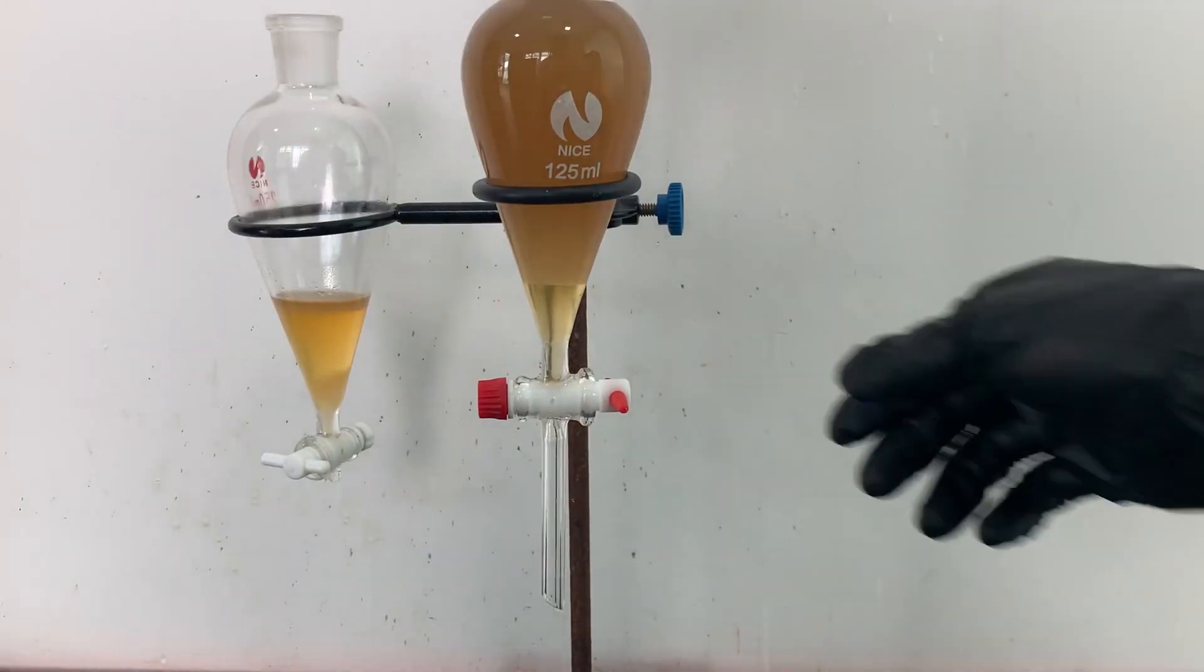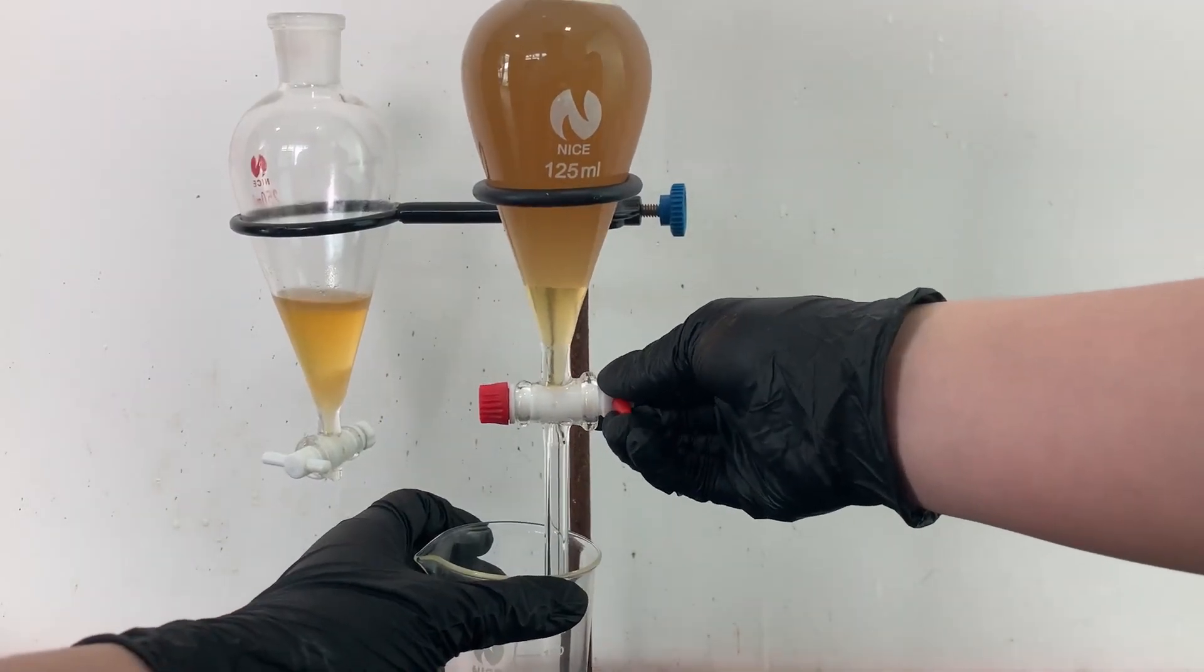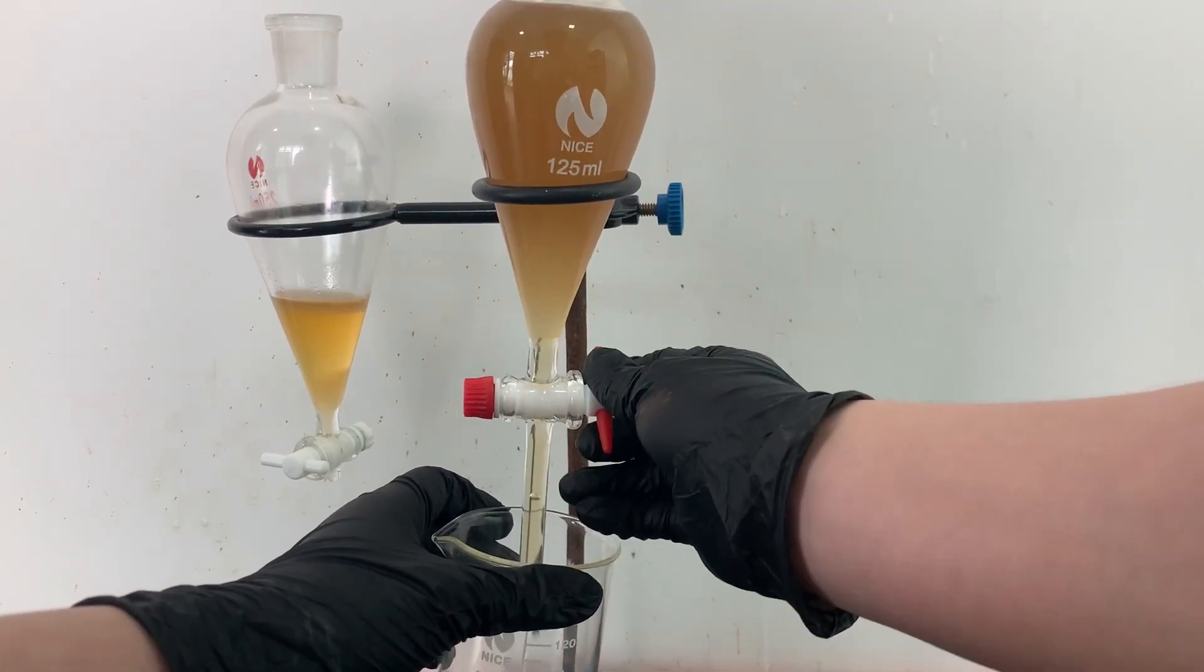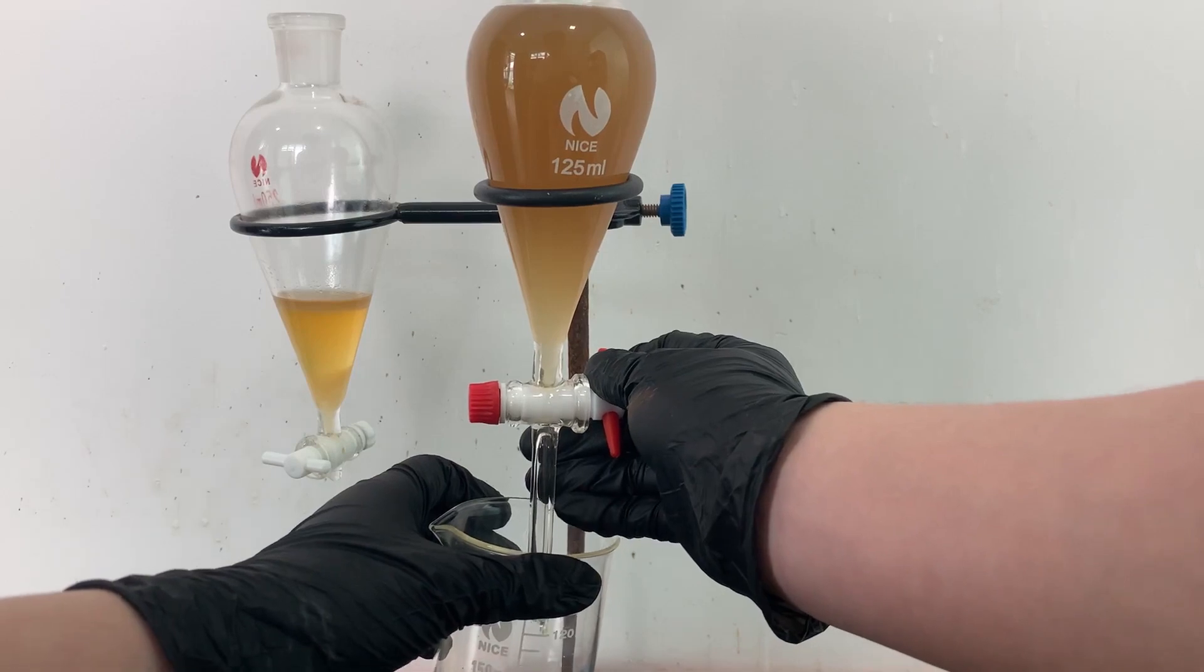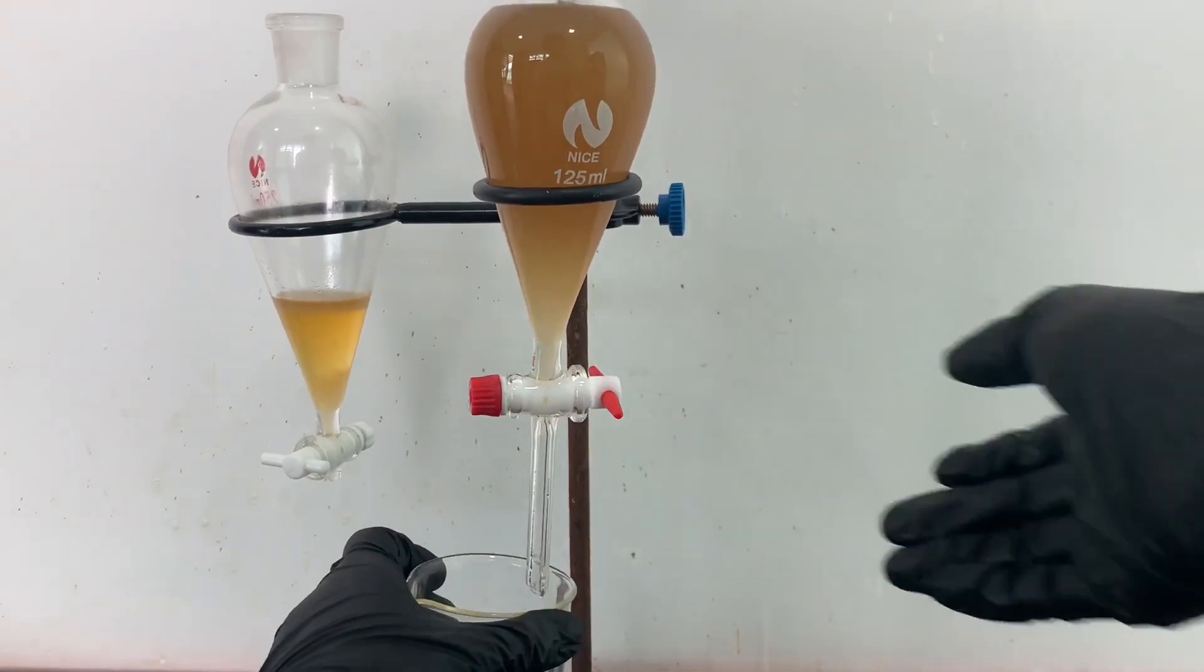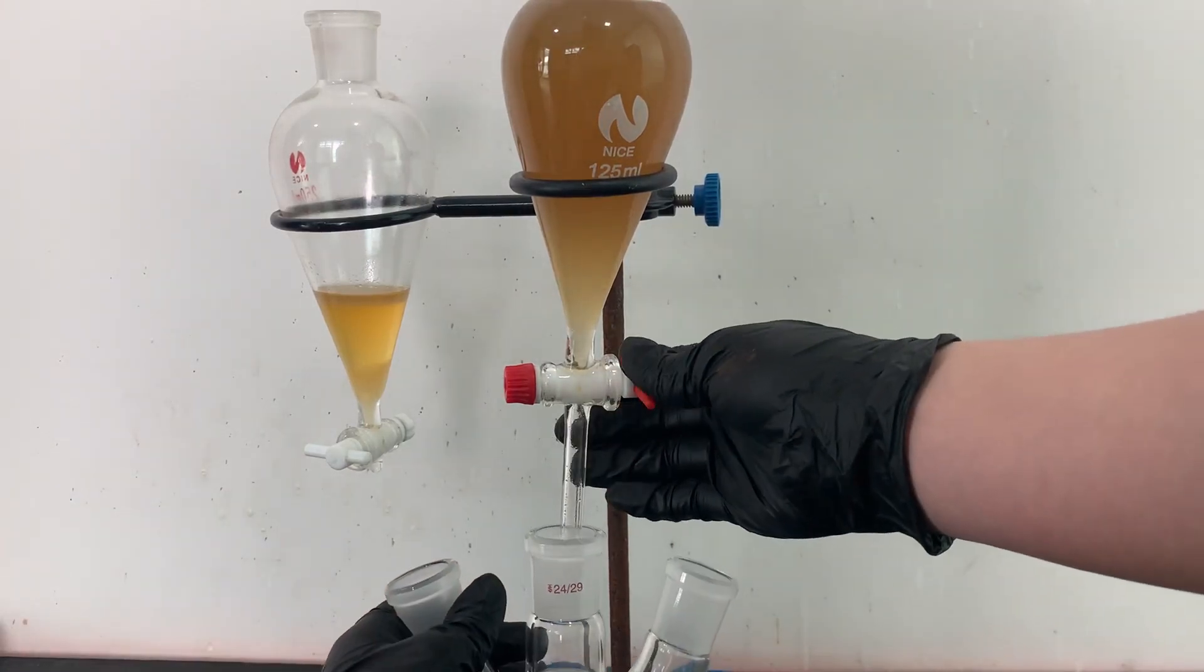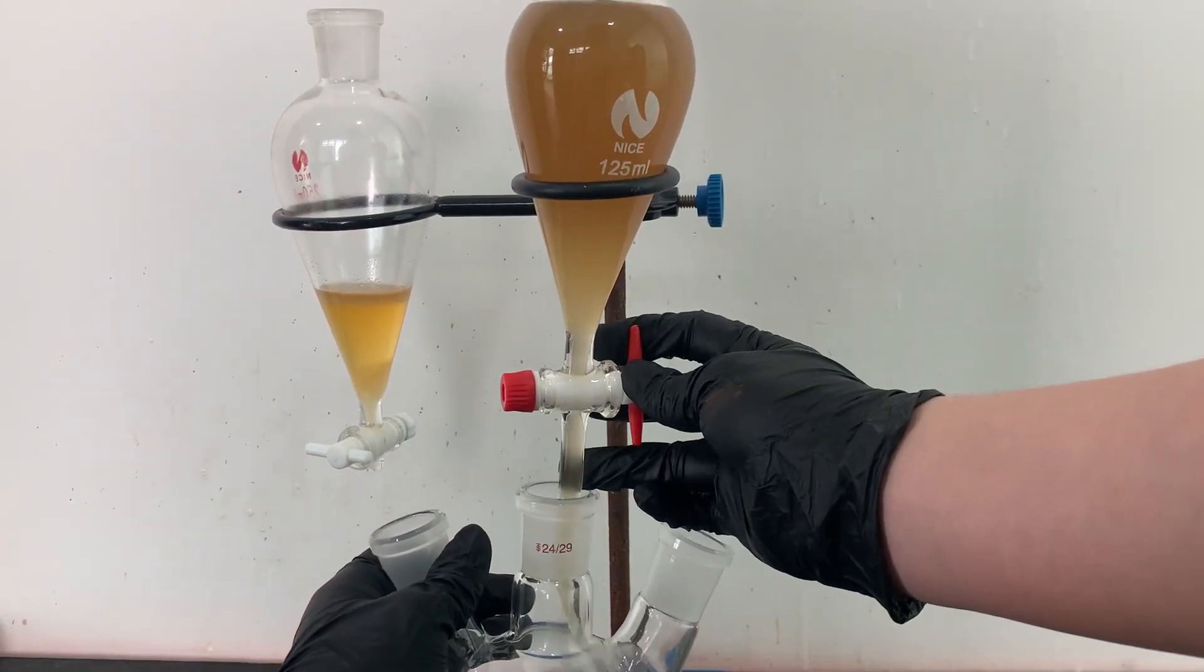The bottom water layer is then drained off into a 250 milliliter flask.